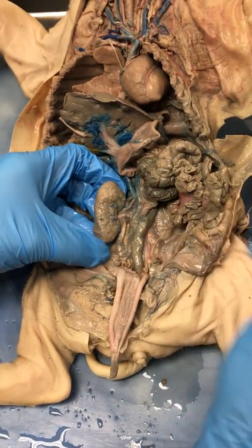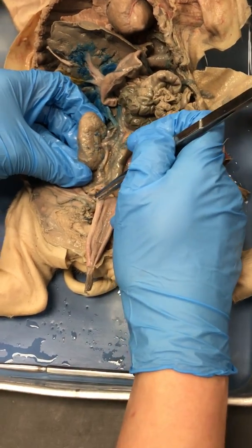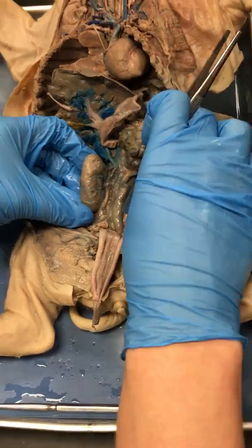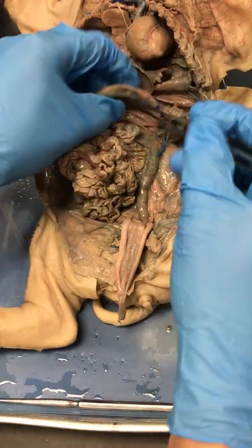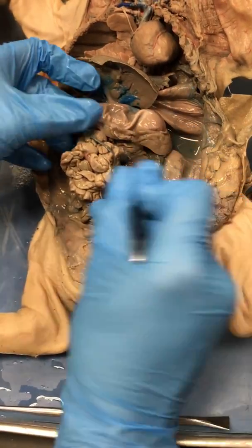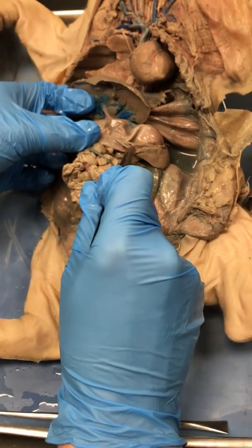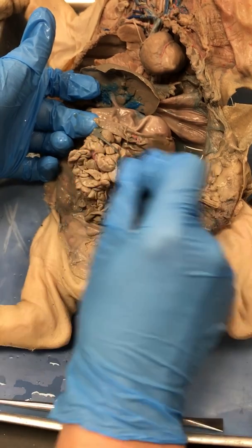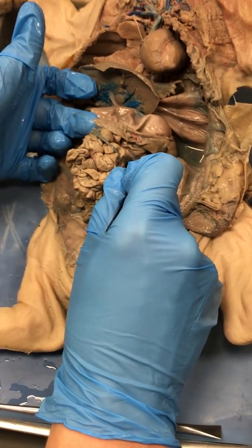Okay, so this video is going to cover our urinary and reproductive tracts, and also what I like to call my mild but mentionable organs. There's one organ that is attached to your stomach over here that we haven't mentioned yet. He's a really pretty smooth organ. He actually plays a role in filtering your blood. This organ is your spleen. He lies on the left side of the abdomen, right next to your stomach.